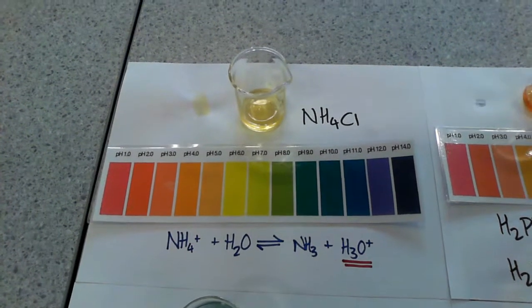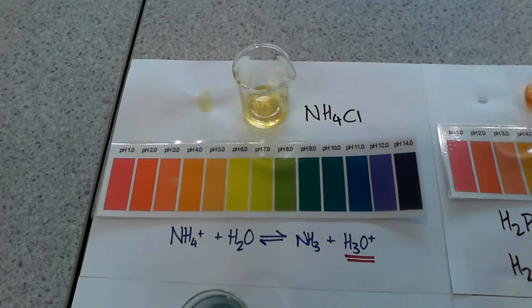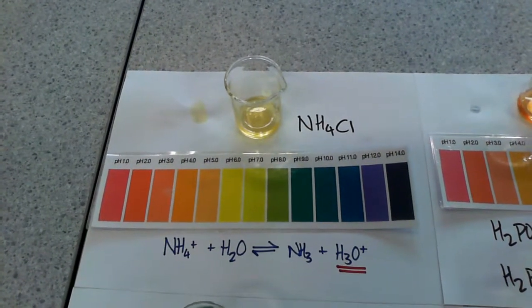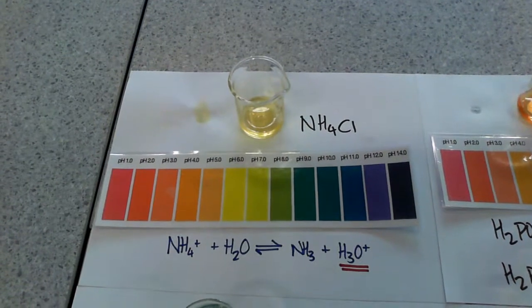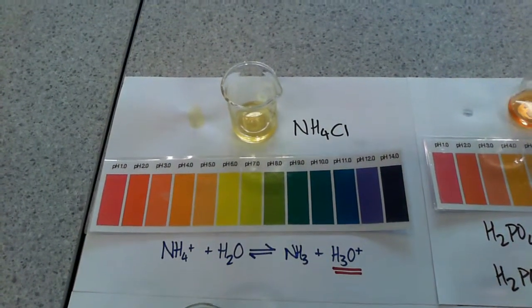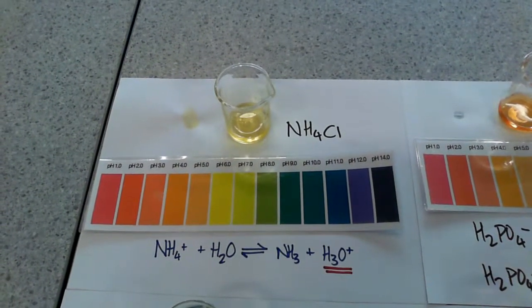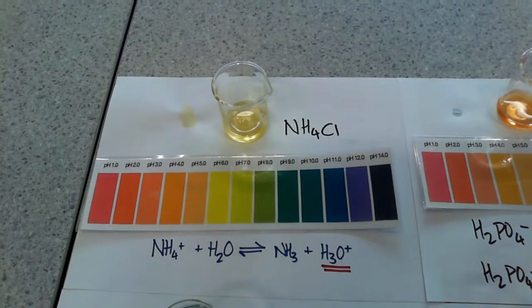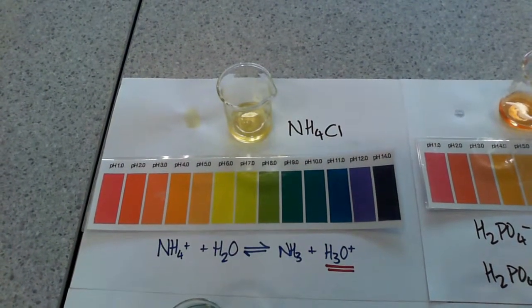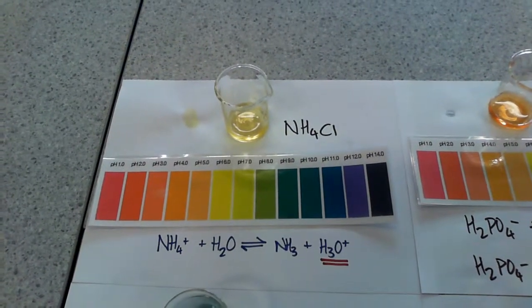Demo looking at a few salts and their pH so we could work out what species are actually in solution. The first one we're looking at here is ammonium chloride, which is slightly acidic. I actually expect it to be more down near the 4 to 5 range rather than 6, but as you can see below, you can write a reaction to show one of those two ions, ammonium, reacting with water or hydrolyzing, increasing the concentration of hydronium ions, and it's this increase of hydronium ions that leads to a pH less than 7.